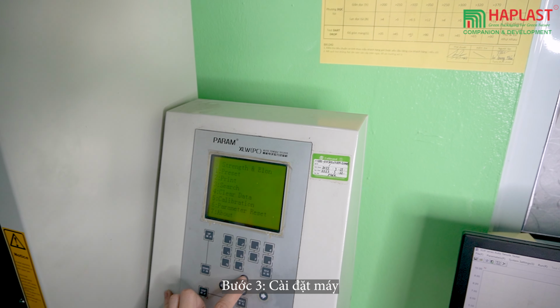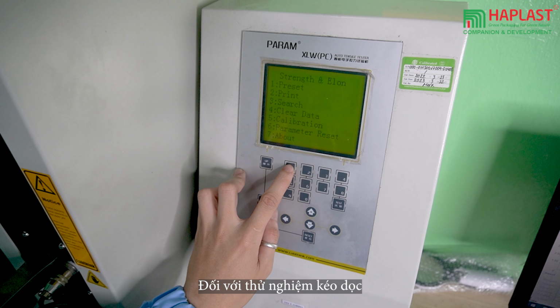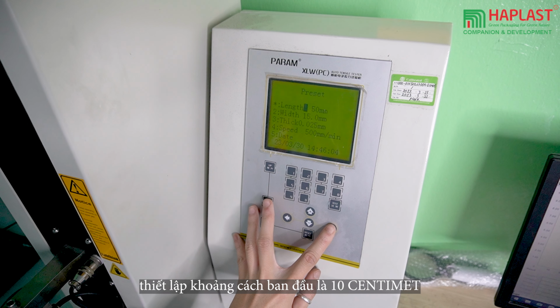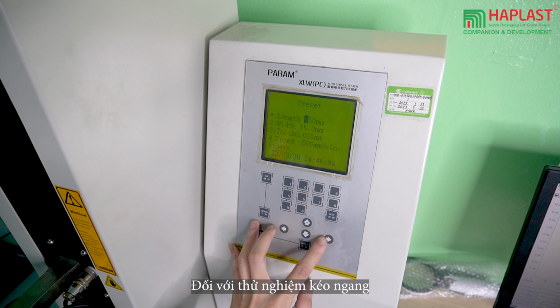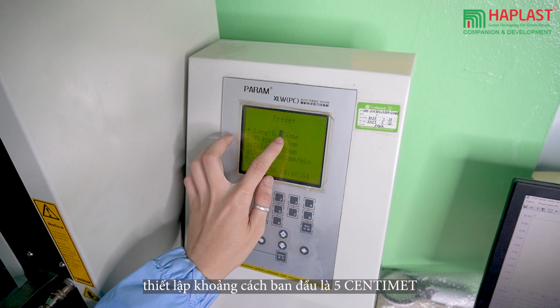Step 3. Setting up the machine. Input the product code and thickness. For longitudinal tensile testing, set an initial distance of 10 cm. For transverse tensile testing, set an initial distance of 5 cm.